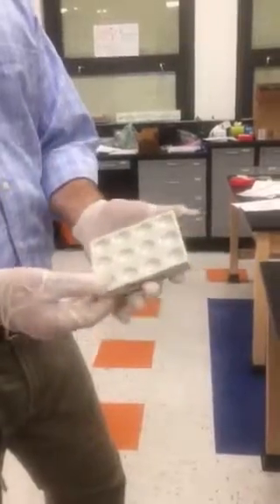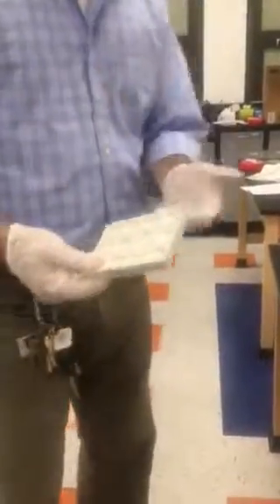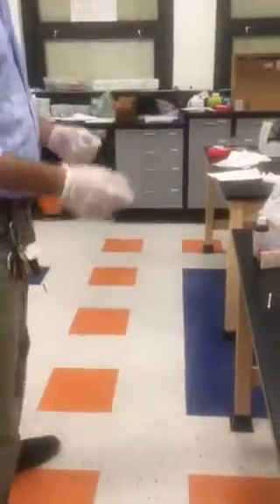You're going to use blue star tablets, which is luminol as seen in the TV shows, to determine which of these 12 wells have had blood in it in the past. And it's just a simple matter of spraying. I'll turn the lights down, and you'll see the nice blue glow, that kind of bluish glow that you see when you watch, say, CSI or any of those forensic shows, and we'll actually get to tell which of these wells had blood in it.